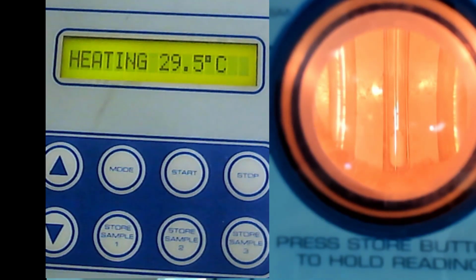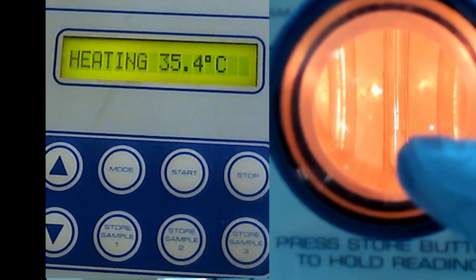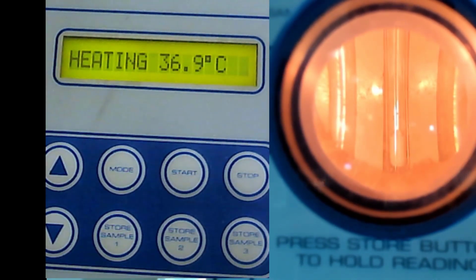Your task now, each of you in a group, remember, know your group members, because you will do your lab report based on group. Your task now is to look through this eyepiece, and when the white stuff there starts to melt, record the temperature, and when it totally melts, record the temperature. Okay, so that's your task. There is some reflection there, but this is the best I can do.